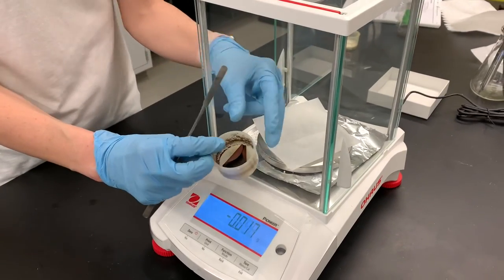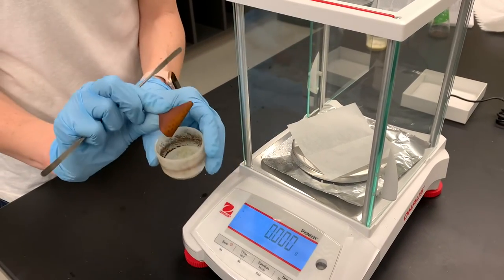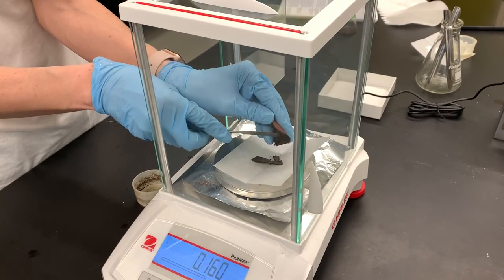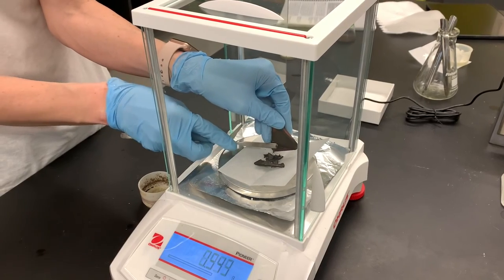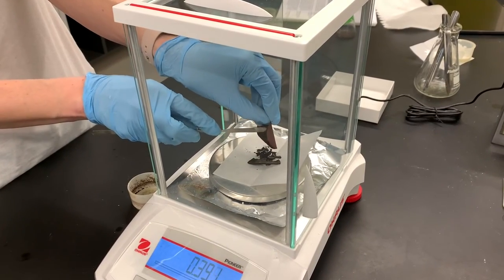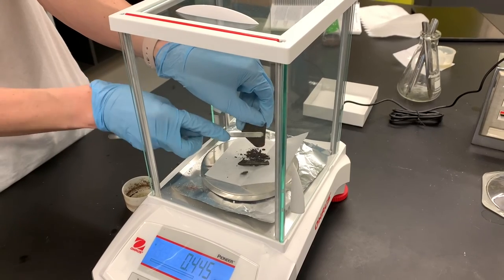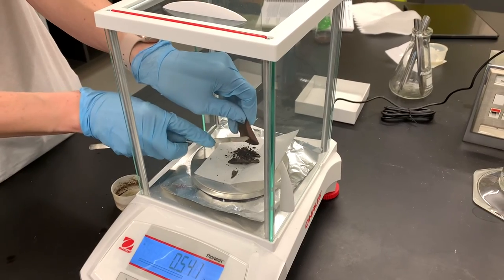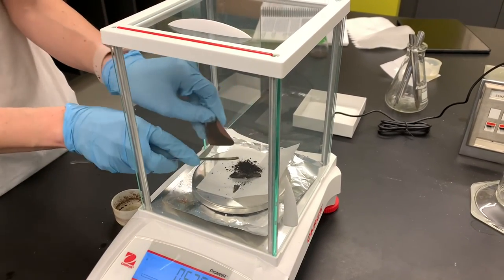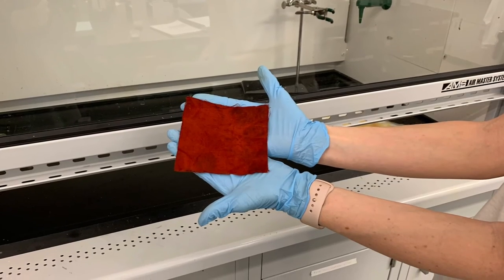Here's the dye that we synthesized — it's curled up in the filter paper. I need to get a mass on it, which means I have to separate it from the filter paper. Notice that it's completely dyed the filter paper as well. It's really solid but also really flaky as I'm taking it off the filter paper, and I'm trying not to get it everywhere because it is a dye.